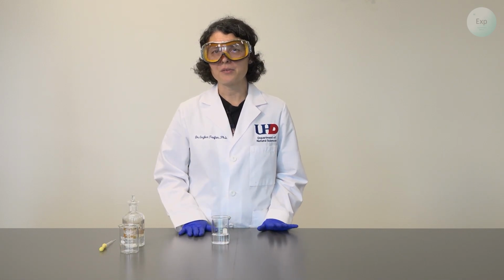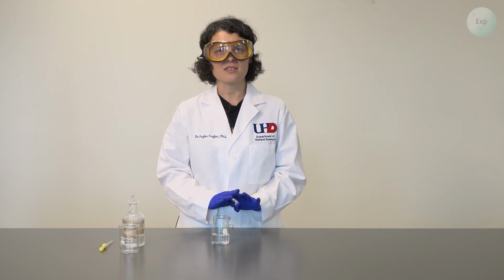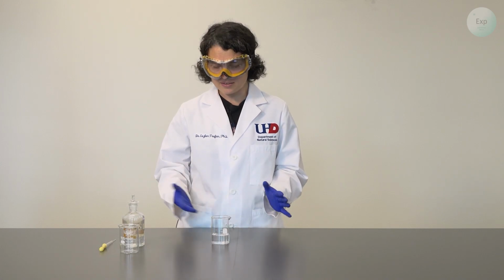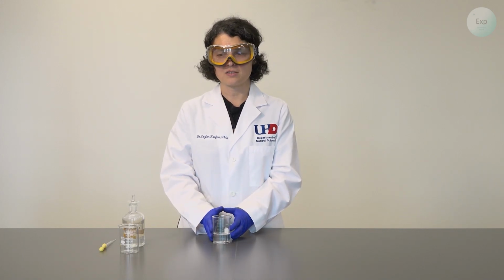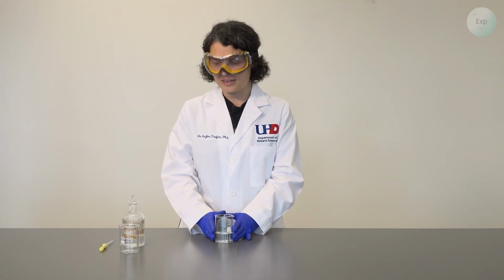If, however, your ratio of sodium chloride and water is not quite matching the solubility limit of sodium chloride, then if you have sodium chloride still floating in your solution, you can always do a quick filtration and the resulting solution will be a saturated sodium chloride solution. At that point, you are where I am in this experiment.